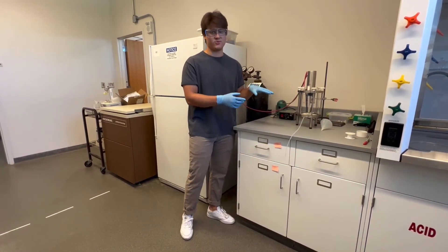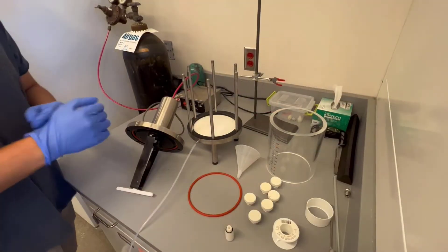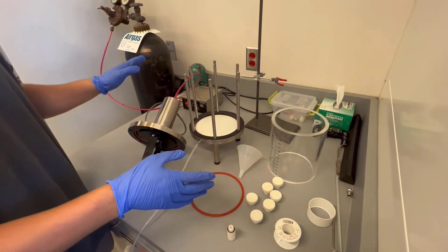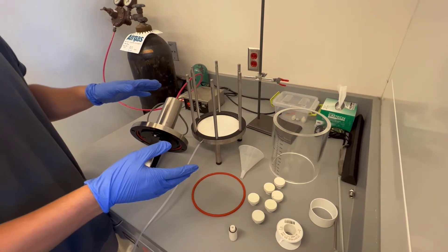So I'm going to take this apart real quick and we'll put it together. Okay, so now we have it all taken apart. This is what it's going to look like when you guys come into the lab.